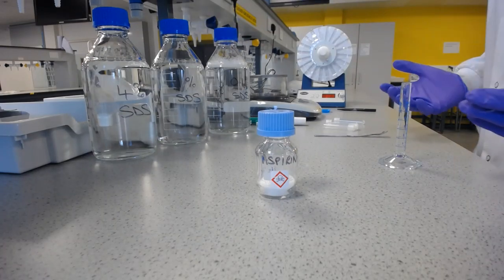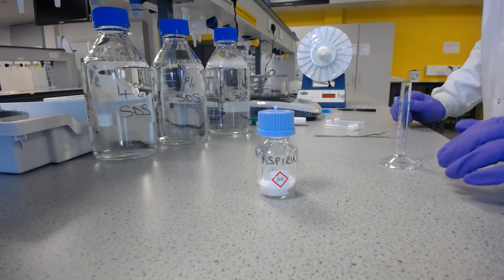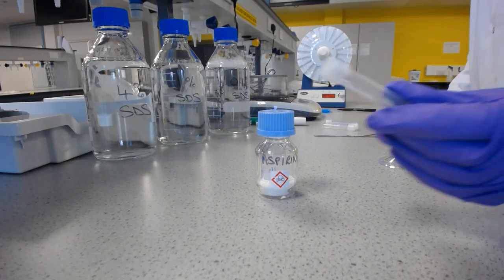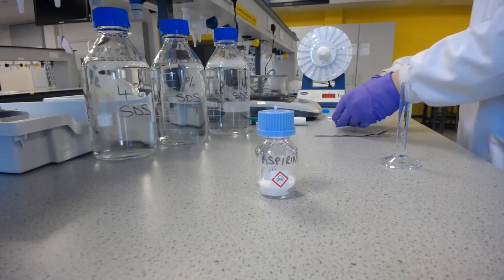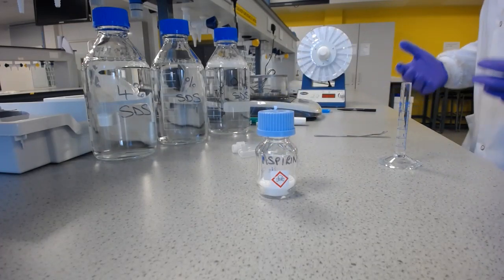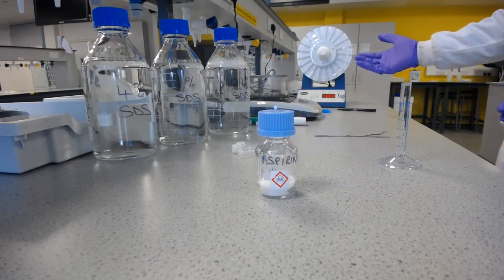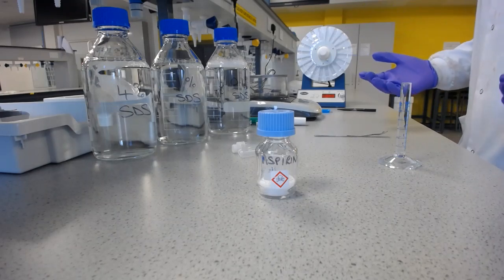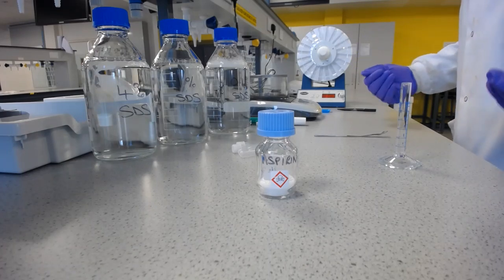So the way we're going to determine the maximum solubility is to ensure that we saturate all of these solutions with aspirin. So we're going to take a small amount of aspirin and the solutions and put them in these plastic tubes. And what we'll do is put a known excess of aspirin in there. We know we're going to saturate the solution, and then we'll leave them to mix for 40 to 45 minutes, so we know we've got as much in there as we can, and then we'll filter off the excess and take a UV vis reading to see how much aspirin is in solution.